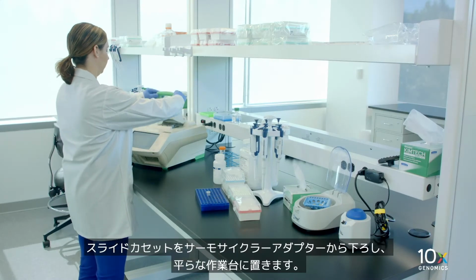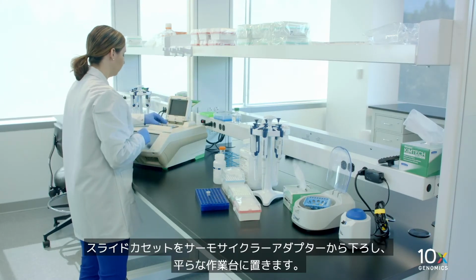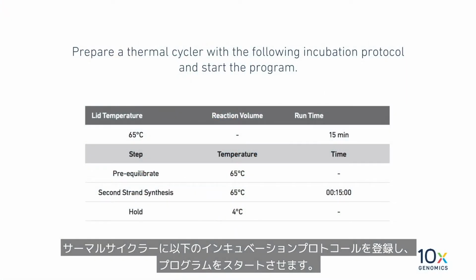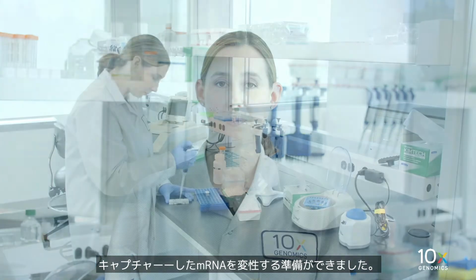Remove the slide cassette from the thermocycler adapter and place on a flat, clean work surface. Prepare a thermocycler with the following incubation protocol and start the program. We are ready to denature the captured mRNA.